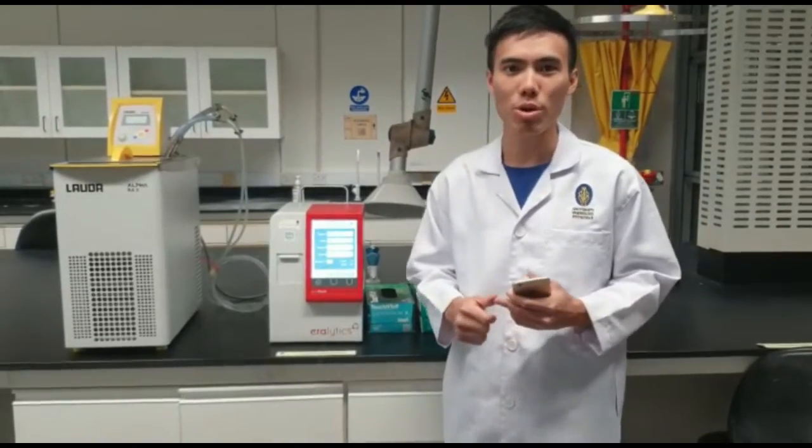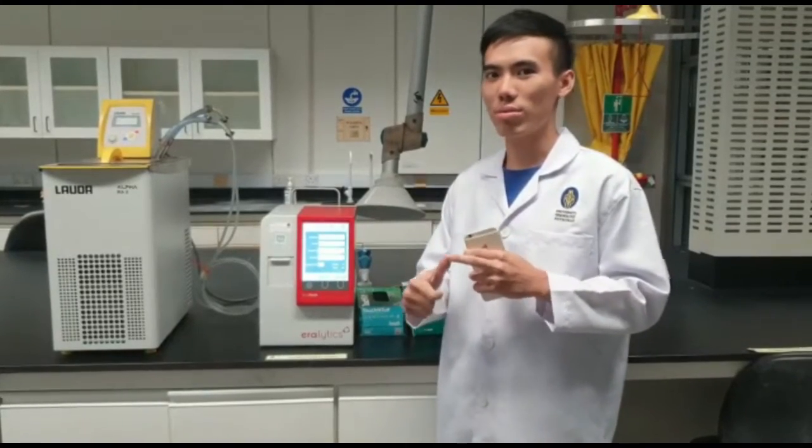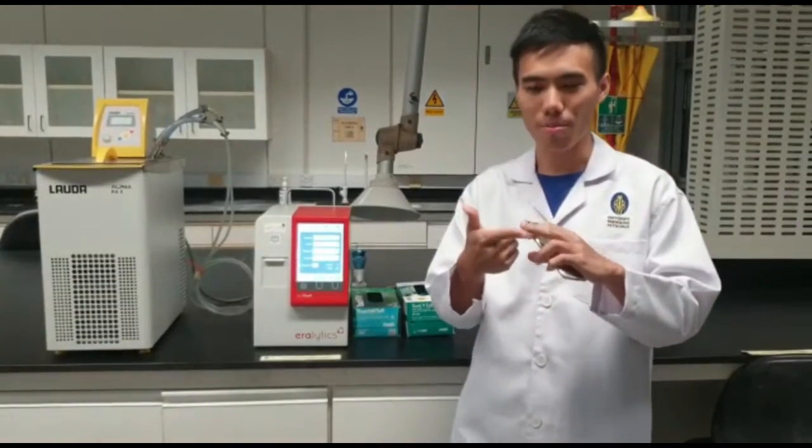For today's experiment, we'll be determining the flashpoint temperature for CRM, kerosene and diesel.